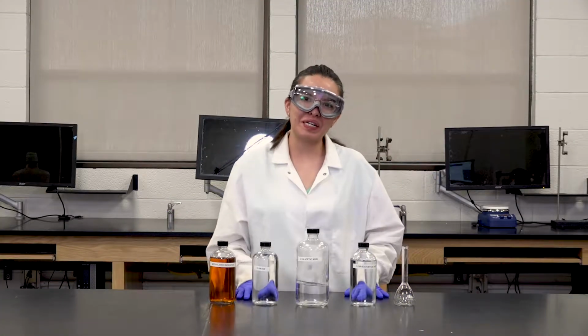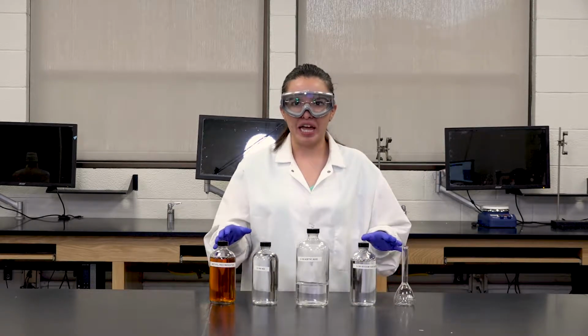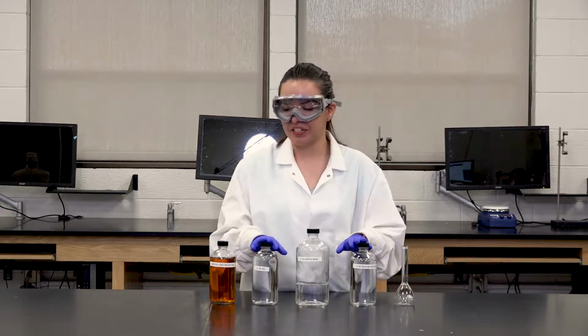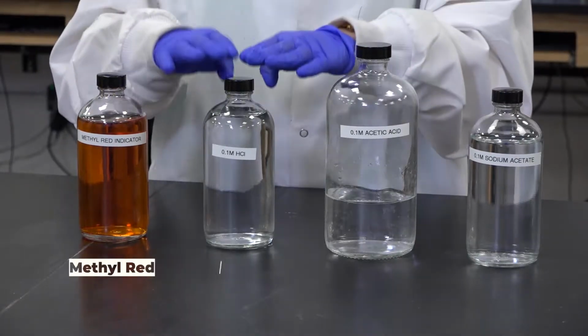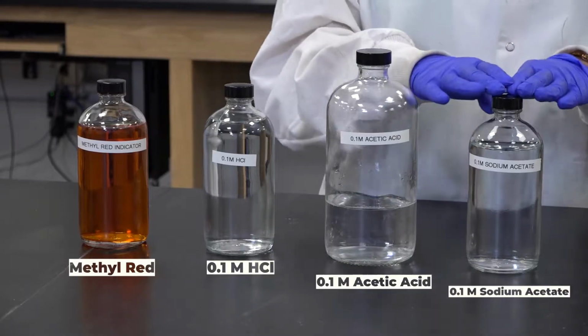Hi guys, I'm Carolina and I'm going to guide you through the experimental portion. We're going to gather all our chemicals. These are going to be our starting materials. We have methyl red, hydrochloric acid, acetic acid, and sodium acetate. If you look carefully at the labels, they each have their respective concentrations.